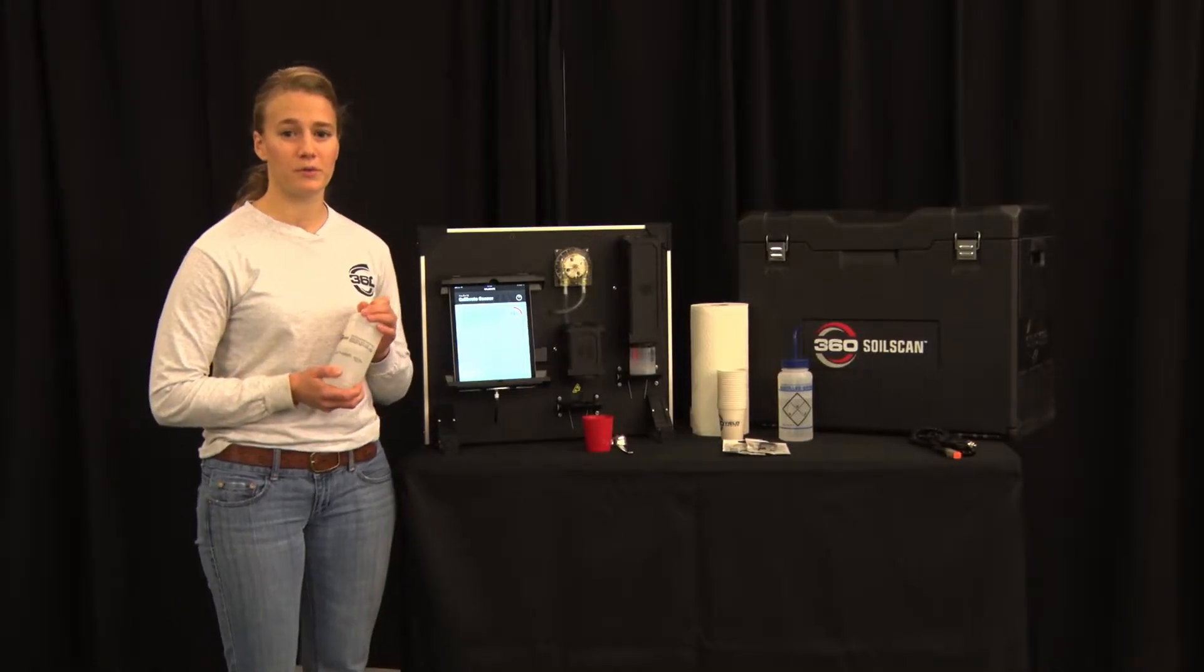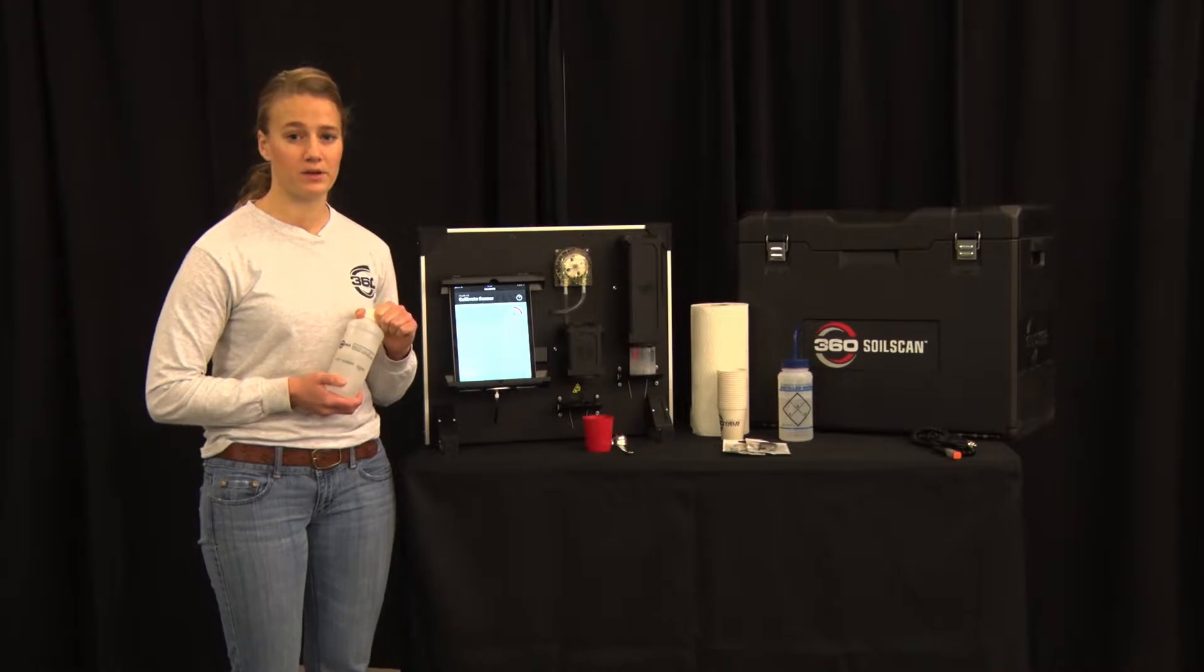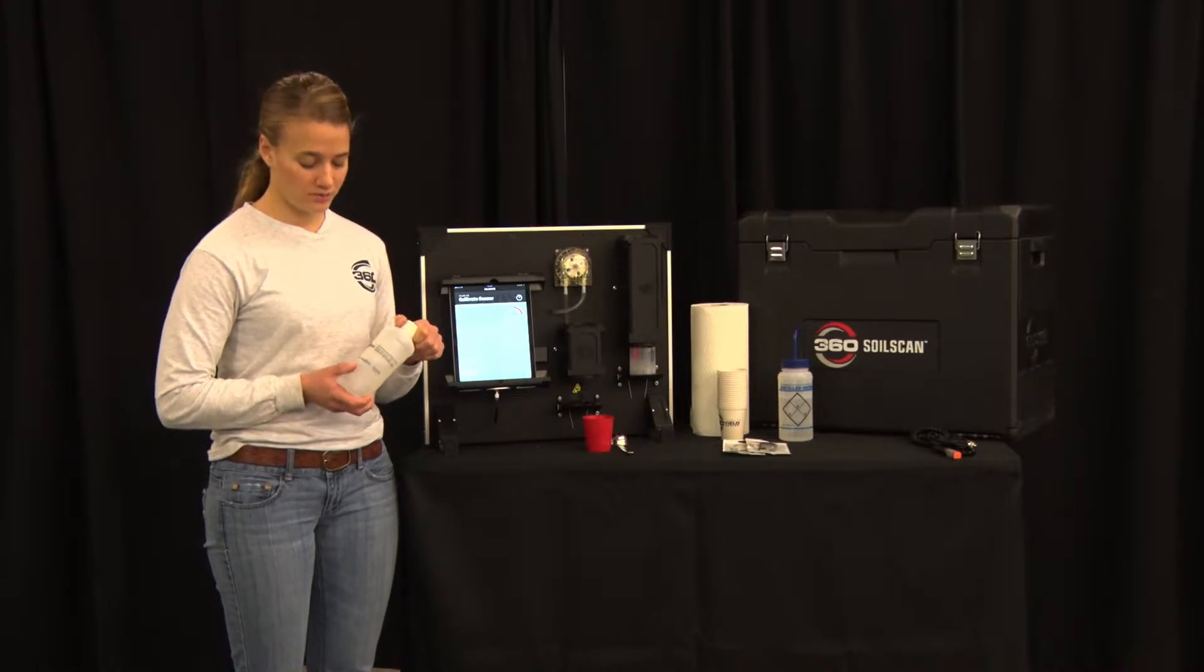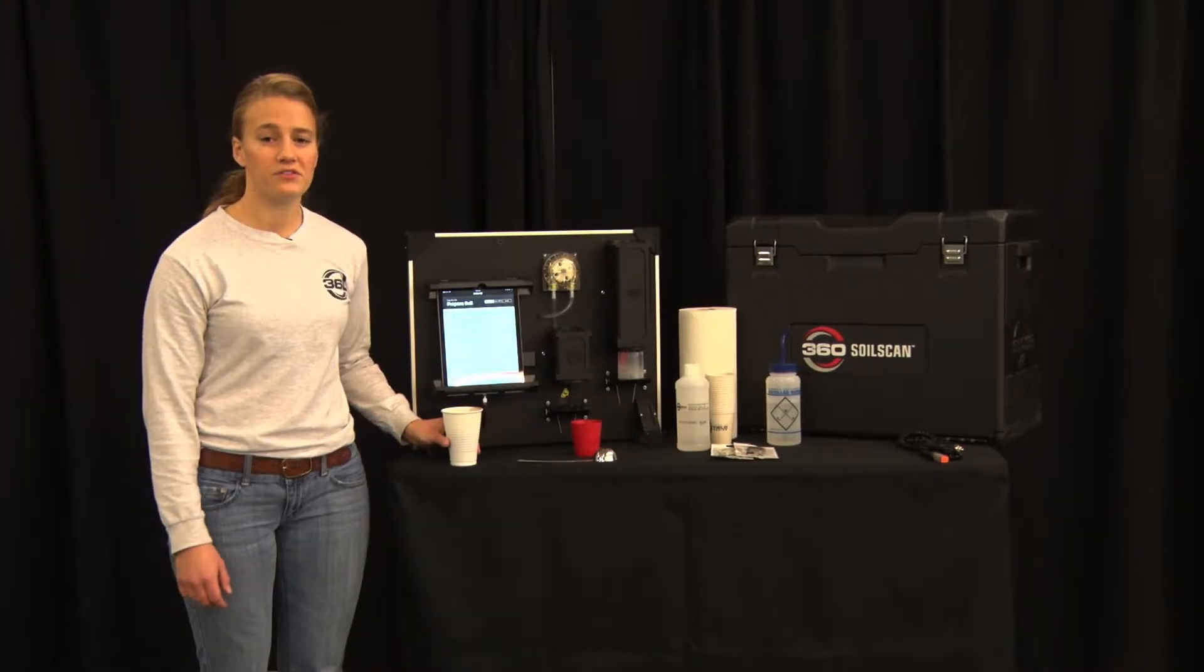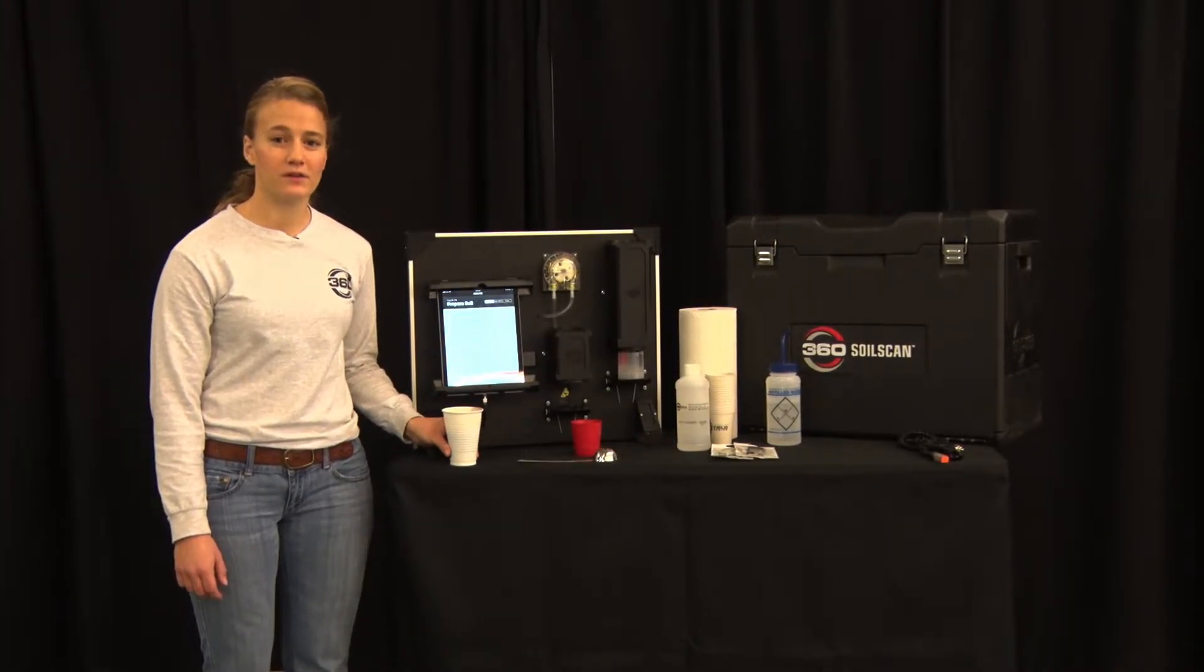Nitrate solution stored from the previous year without ever having been opened is good to use. However, if it's an open bottle you will need to replace it. Now that the sensors have calibrated we can get started mixing dirt.